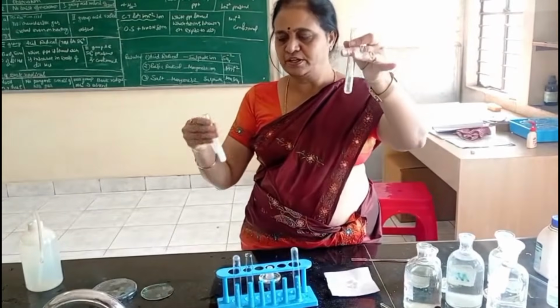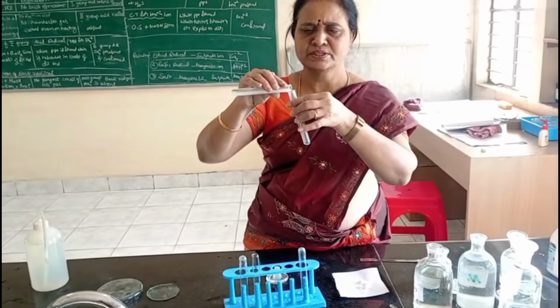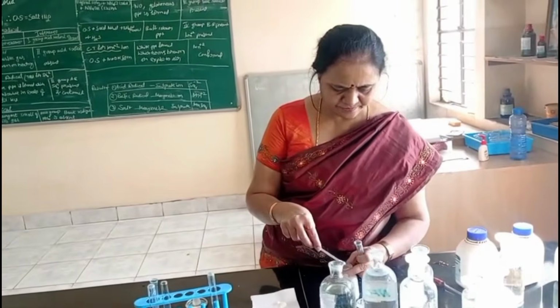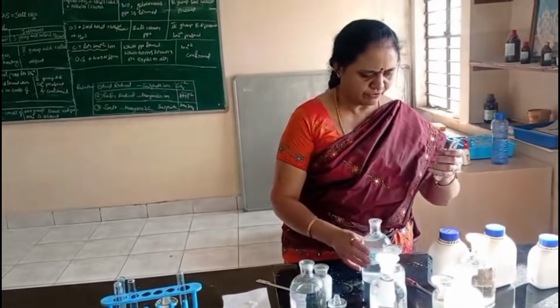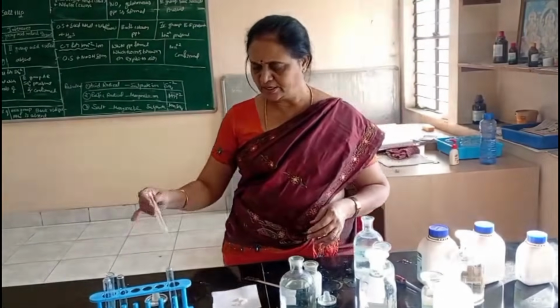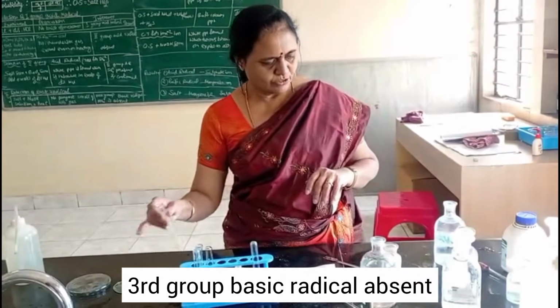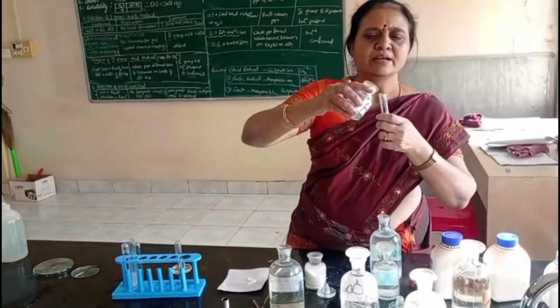So for detection of third group basic radical, I take original solution. For this original solution, I am adding solid NH4Cl. Then I am adding NH4OH solution in excess. See here, I am taking original solution, solid NH4Cl and NH4OH excess. I am not getting any precipitate. So I am adding H2S.